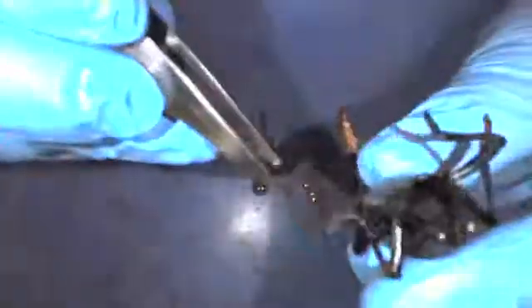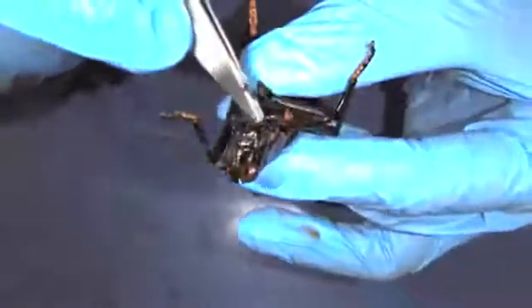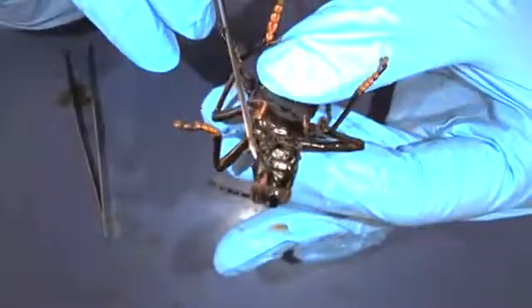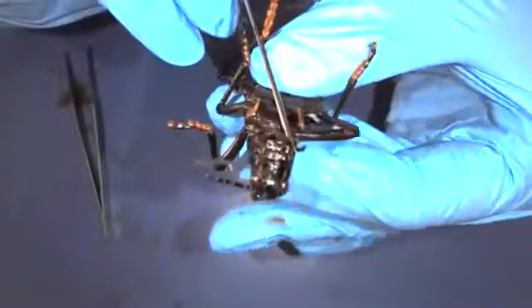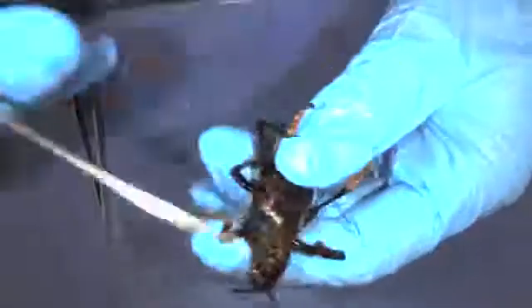If we take a look at the head again — we talked about the eyes and their antennae — they also have a mouth, which might be a little tricky to see. Let me try to focus a little closer. On their mouth they have a mandible, like a jaw, and they also have really small feeding appendages. If I pull this away, you can see it looks like a mini arm around the mouth — these help bring food in.